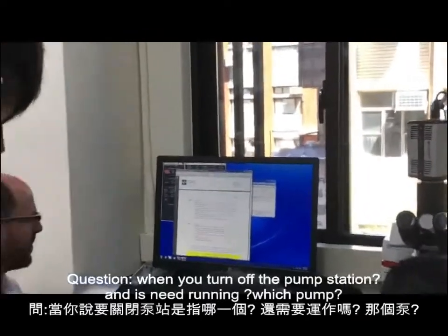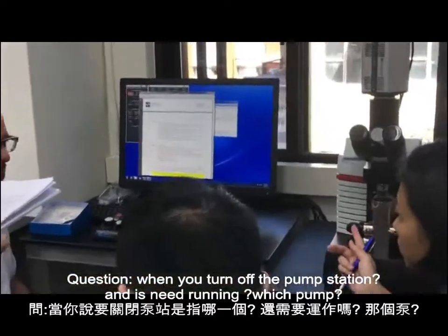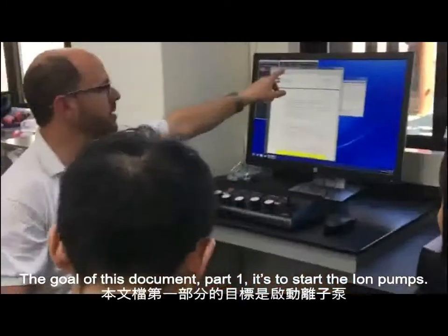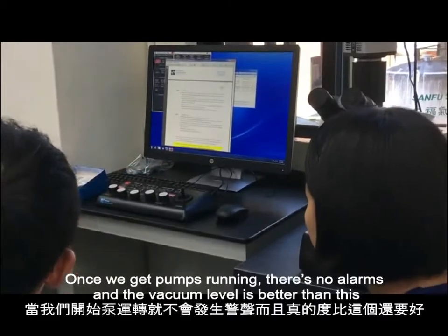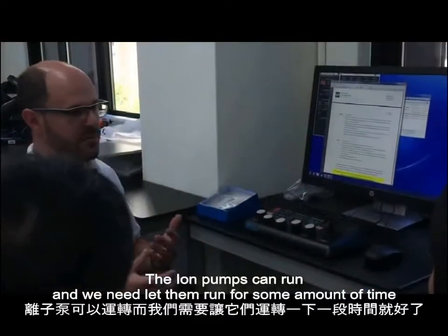Sorry. So when you turn off the pump station, is it running, pumping, which pump? Ion pumps. So the goal of this document, part 1, is to start the ion pumps. So that's the 30 seconds on, 3 minutes off, the back valve. Once we get the pumps running, there's no alarms, and the vacuum levels are better than this, the ion pumps can run, and we need to let them run for some amount of time.